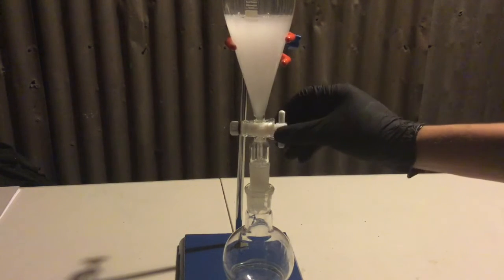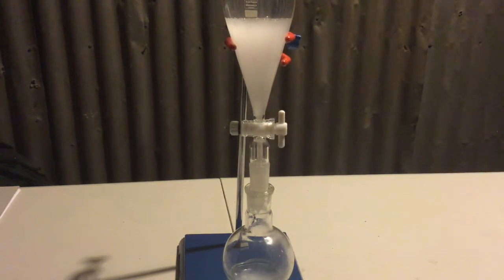After this the bottom organic layer was transferred to a flask. This exact washing process was then repeated 4 more times.